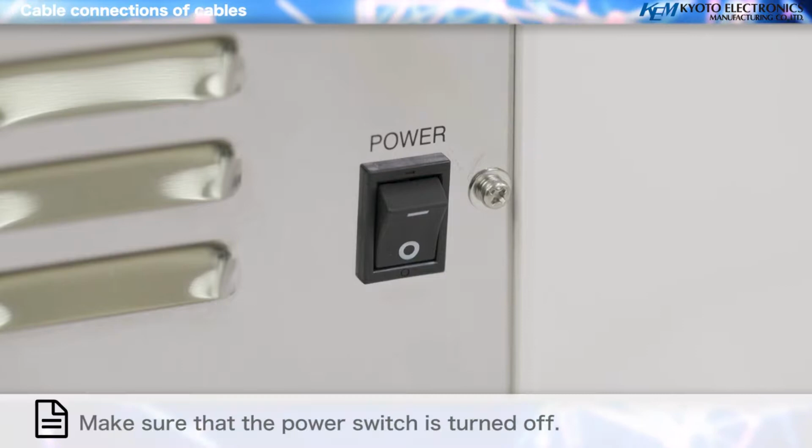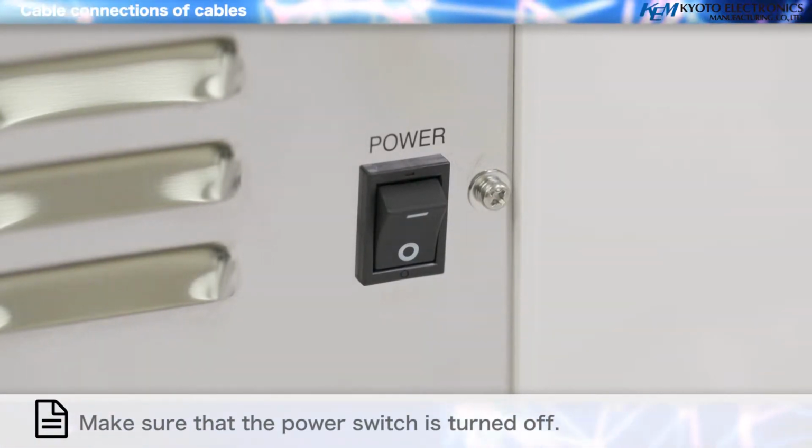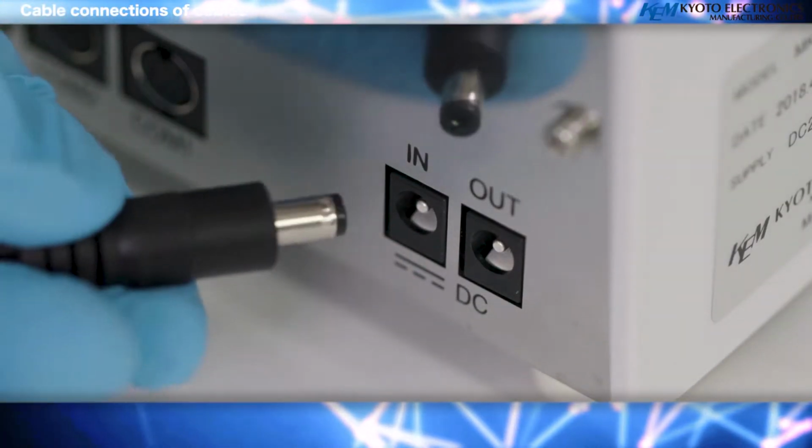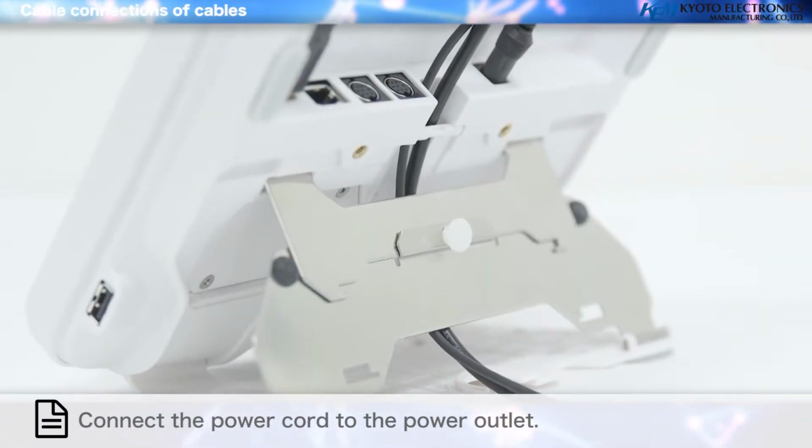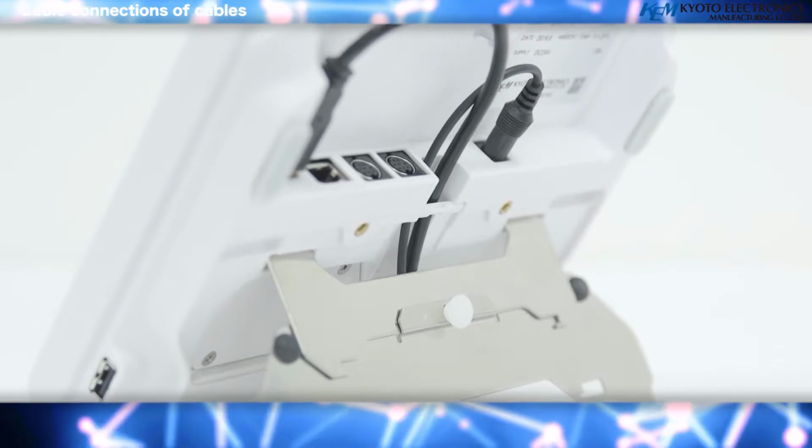Connections of cables. Make sure that the power switch is turned off. Attach the power cord to the AC adapter and connect the connector plug of the AC adapter to the power connector on the back of the main unit.